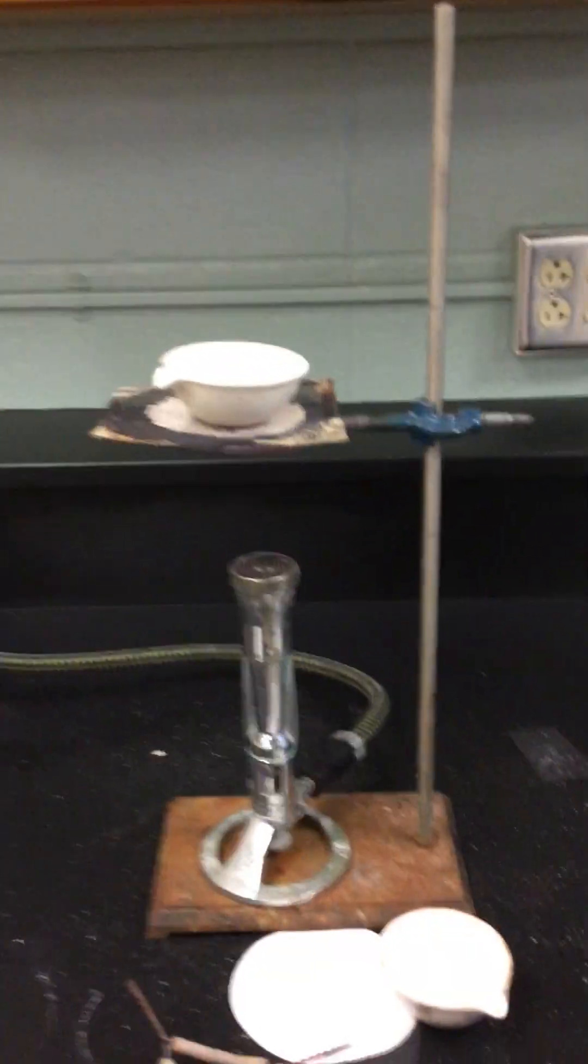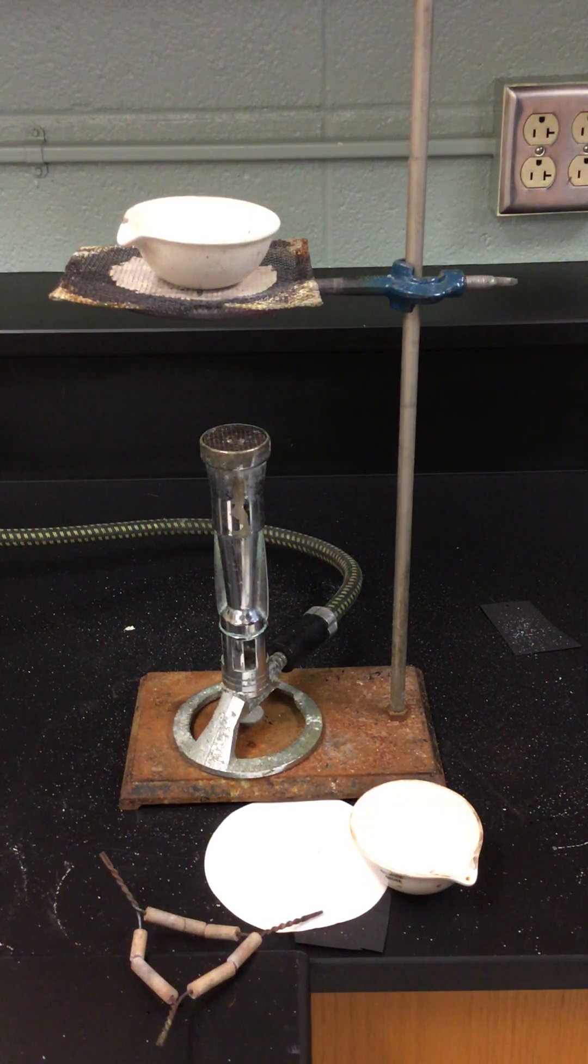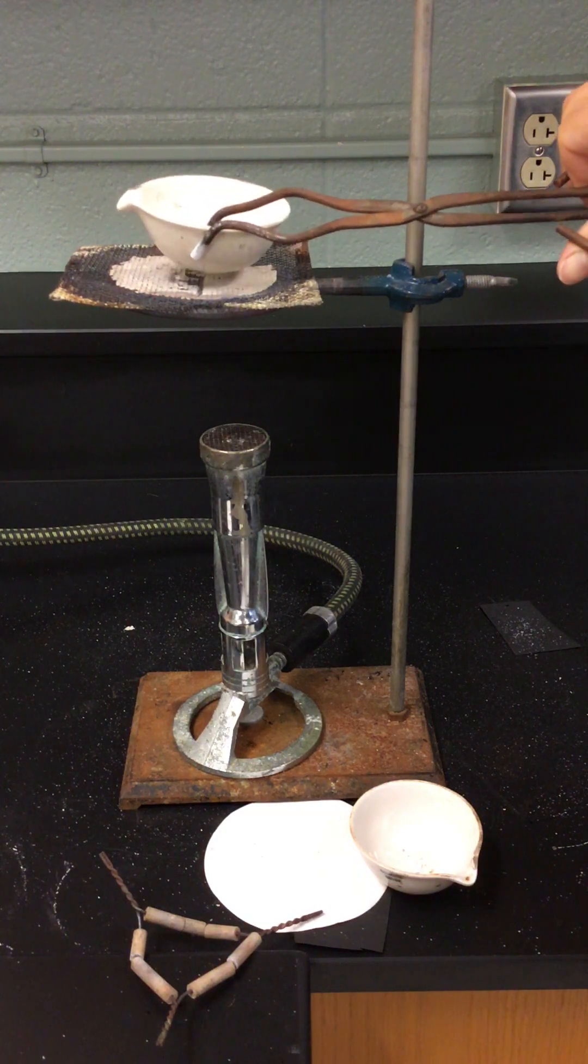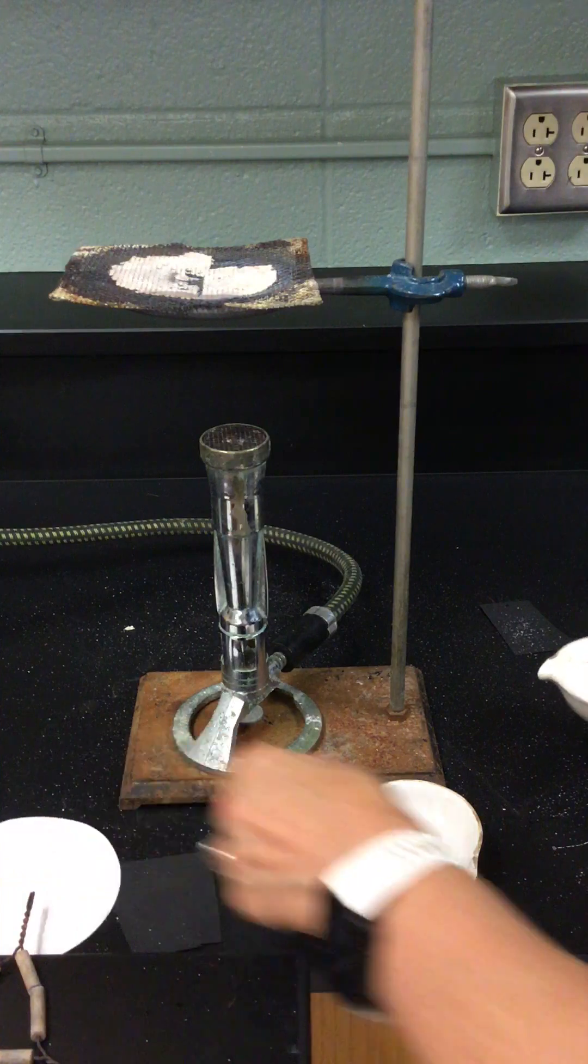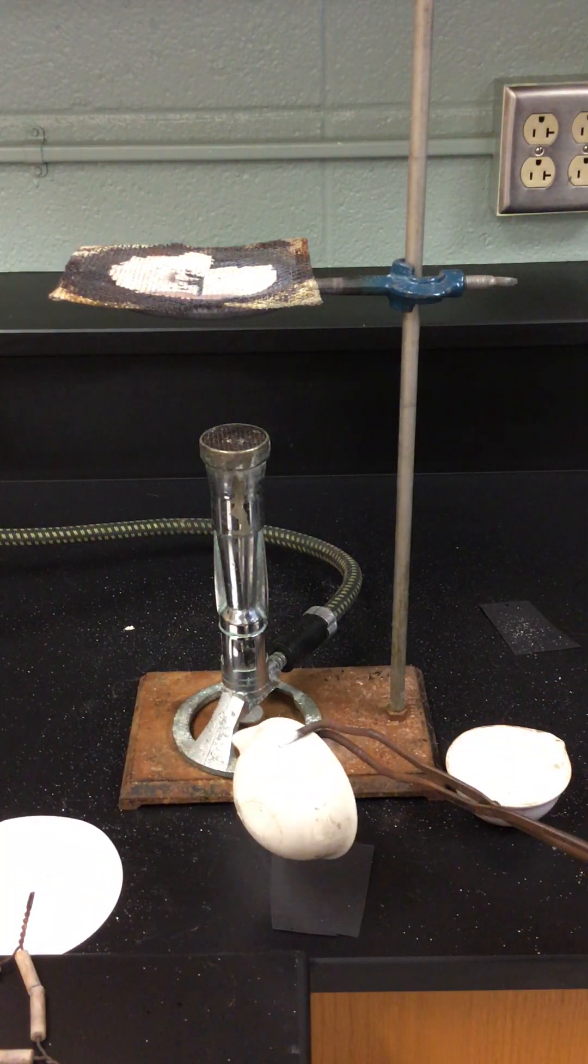This is very hot right now but let me see if I can force this off a little bit. And I'm gonna see if I can shake out this, would start my paper on fire if I get it too close to. I'm gonna put it on this, this is probably safer.